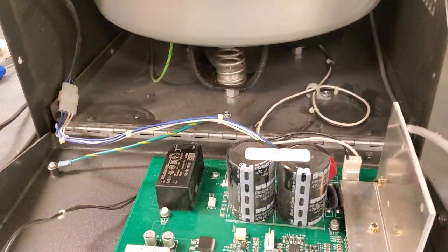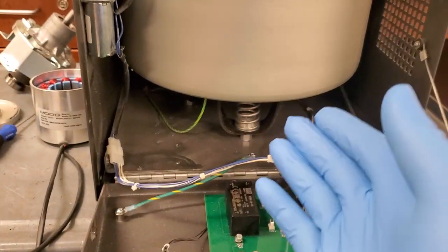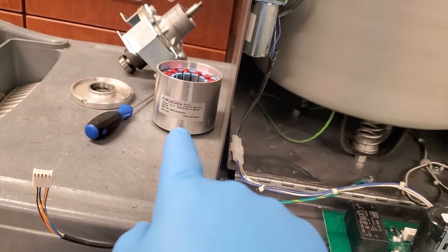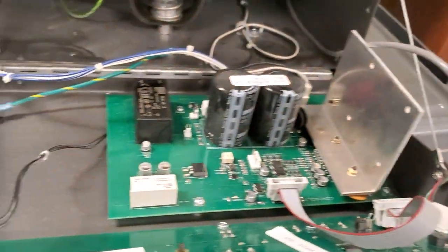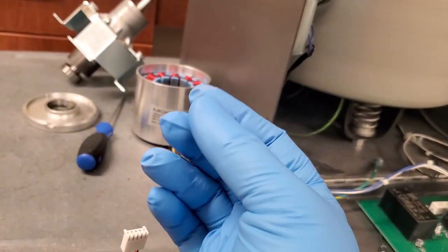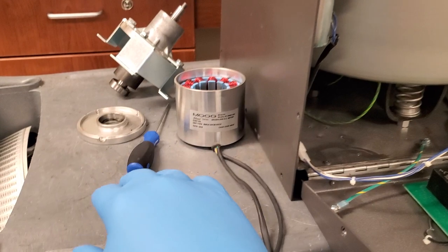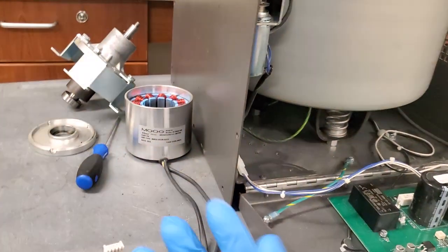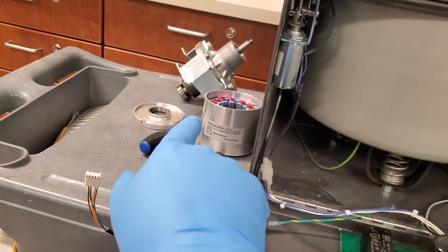This is why it's so important to understand what type of motors are going on inside your equipment so that you know how to troubleshoot it better, because just saying that the brushes are bad, honestly, I haven't seen brushed motors in a centrifuge in a while for obvious reasons. These ones here are way more durable. The speed control, which is actually done right under here, is the driver, is so much more efficient than brushed motors. And brushed motors also generate EMF, which is electrical noise. If you have a small centrifuge like this in a laboratory near a certain device, or in an operating room, which they do have small centrifuges in some operating rooms, then that EMF is going to interfere with other devices like EEG. So, brushless three-phase, very efficient, very powerful motor choice.